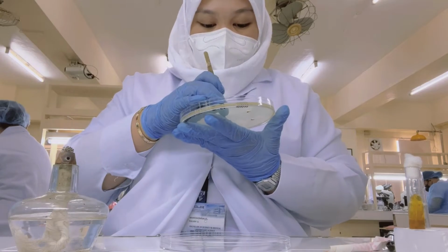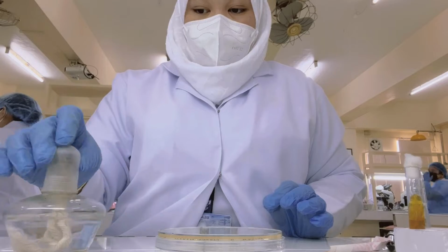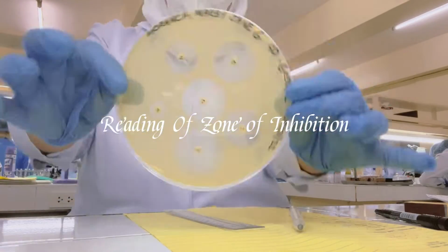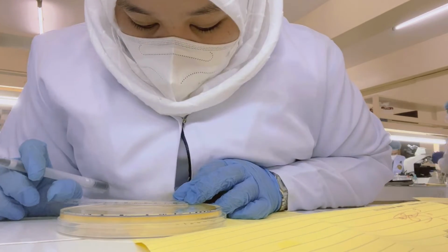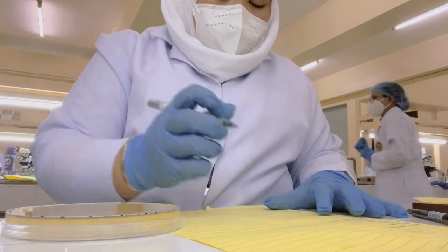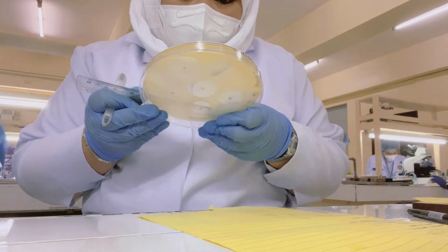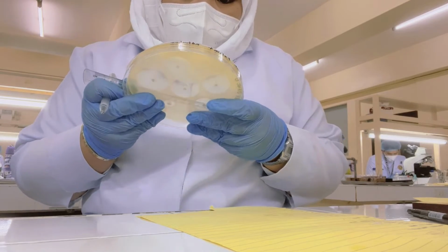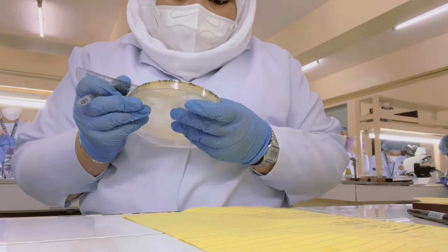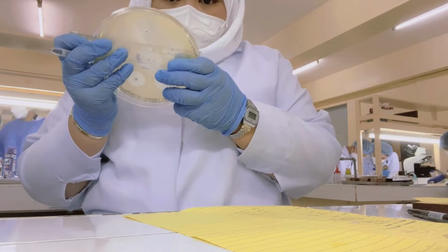After putting all the antimicrobial discs, incubate the Petri dish for 24 hours and observe zone of inhibition. To determine whether the bacteria is susceptible or resistant to the antibiotic disc, measure the diameter of the zone of inhibition using a ruler. For the criteria, zone of inhibition with a measurement of greater than or equal to 18 mm means susceptible. 15 to 17 mm means intermediate. Less than or equal to 14 mm means resistant.